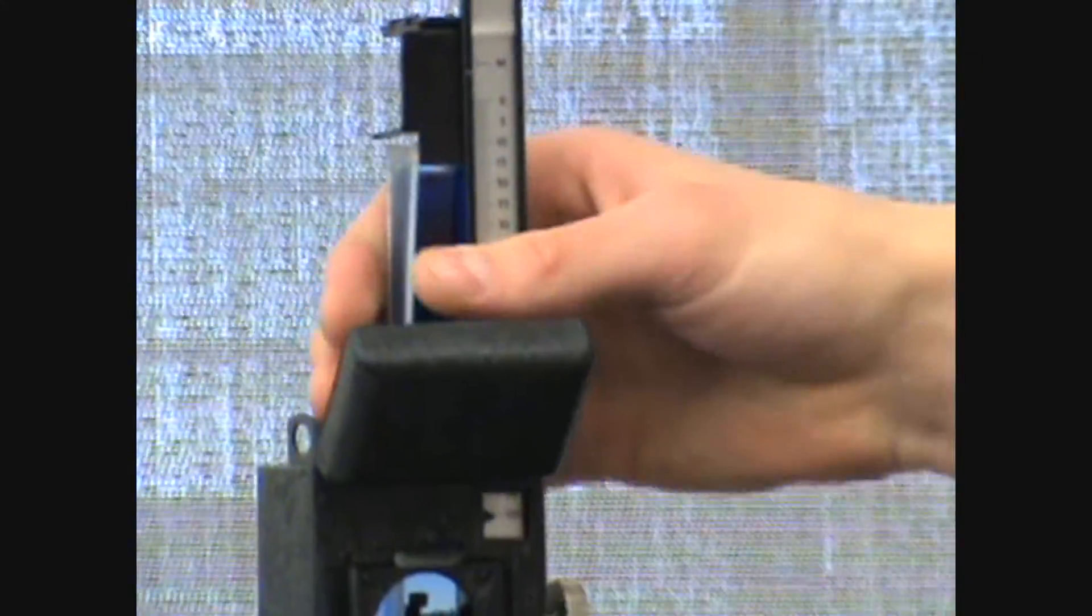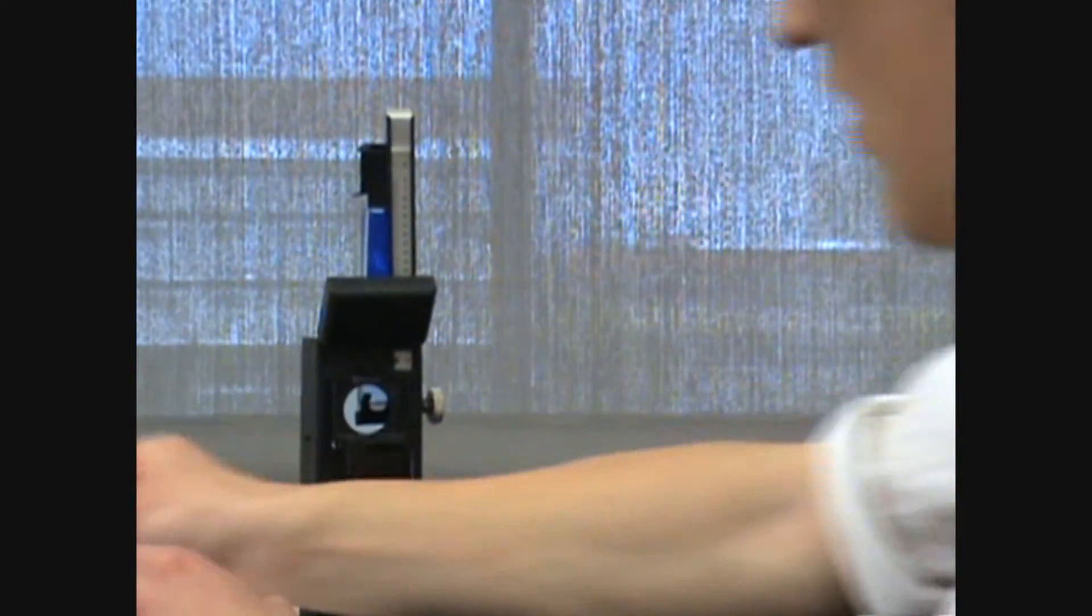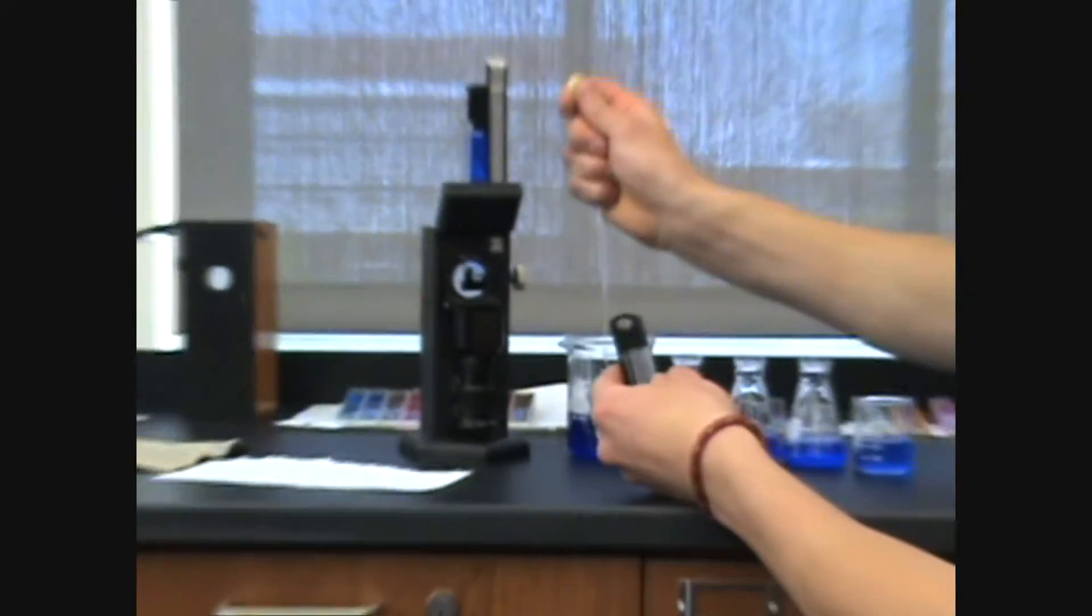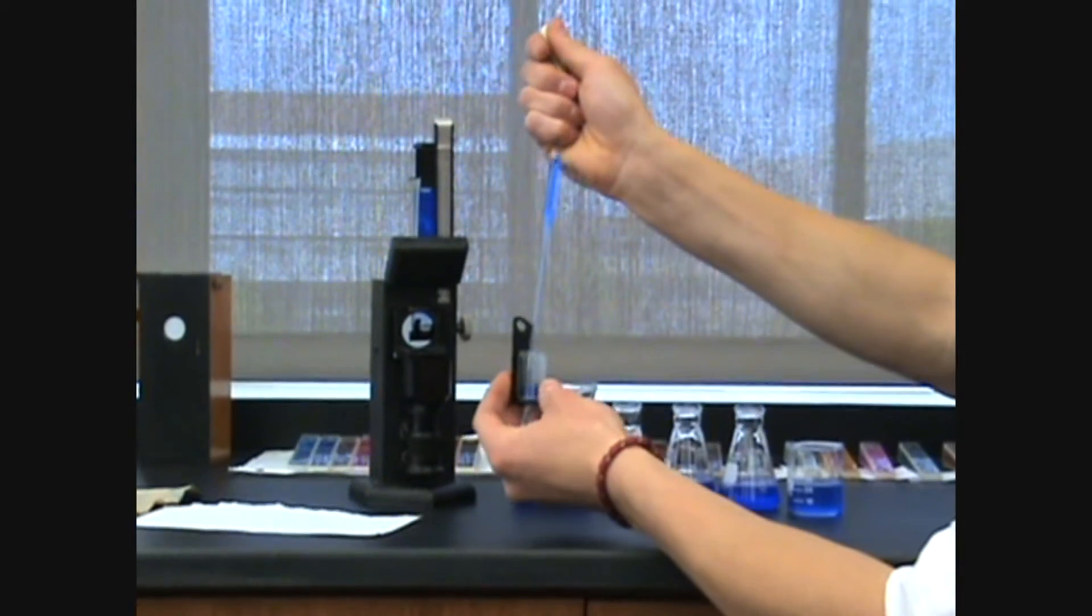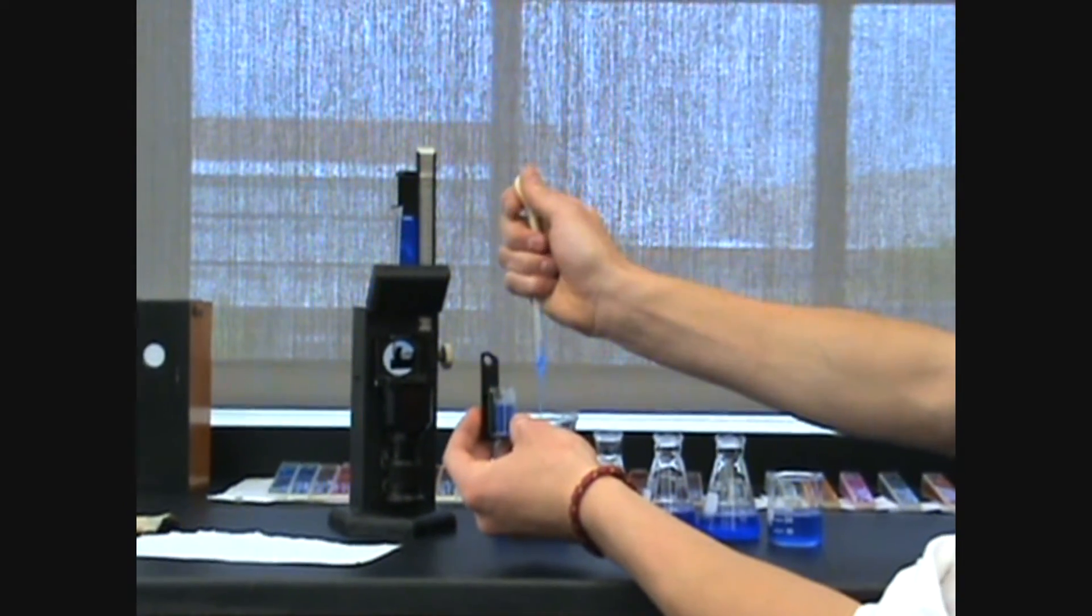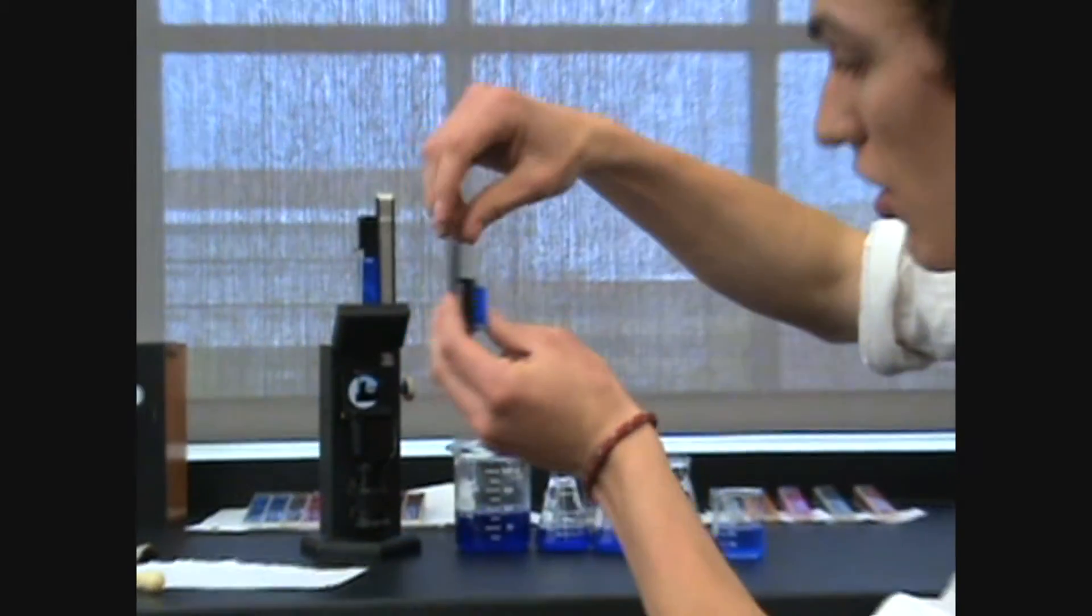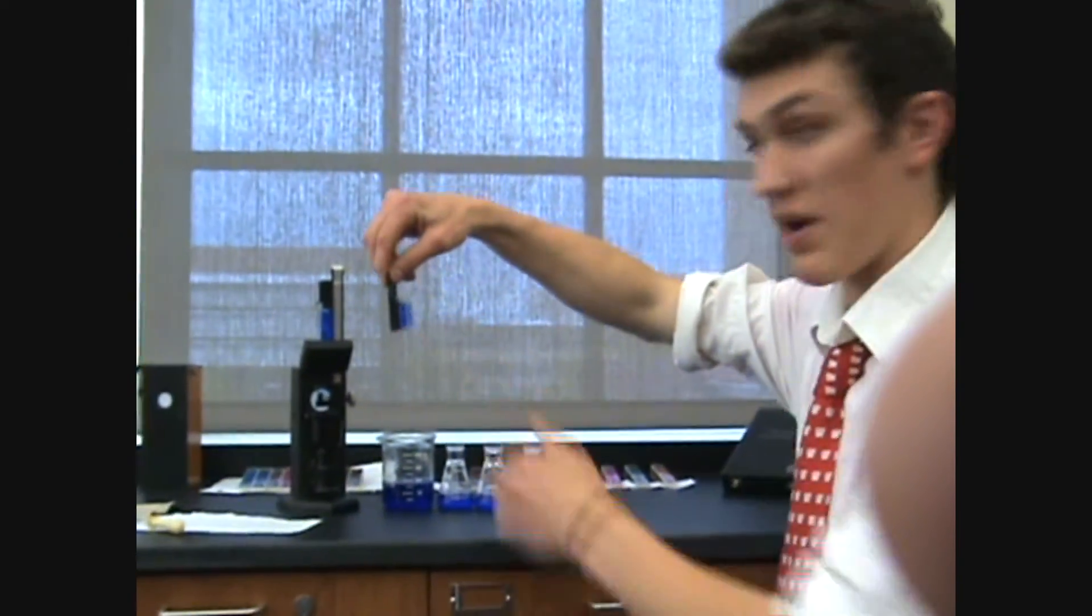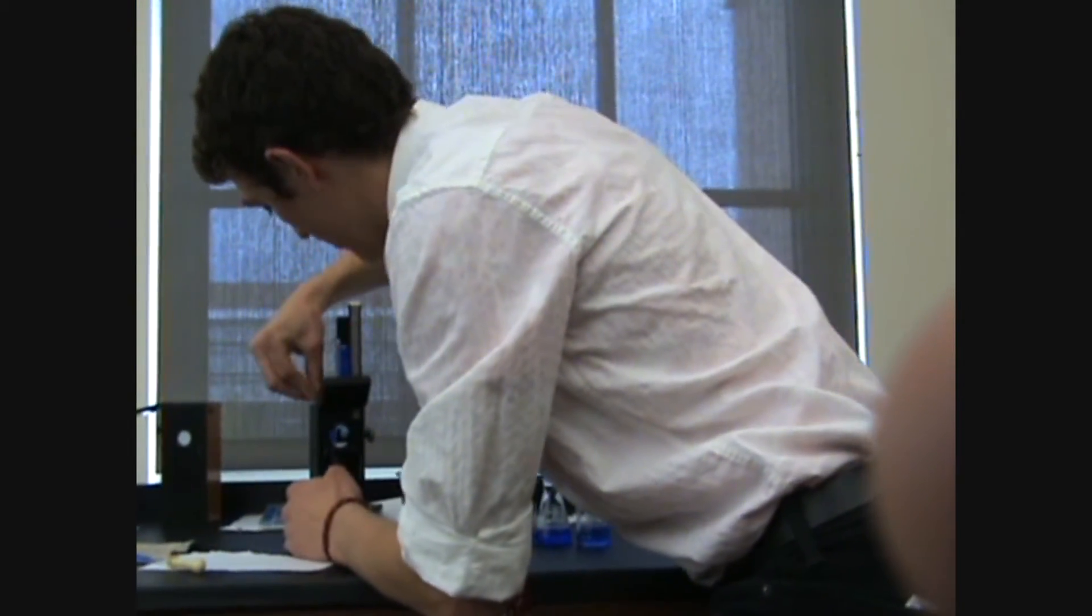So, what I first did, I had my cup, and then I took the 100% with the pipette, filled up the cup, making sure that there are no bubbles that will alter the light path. And I put it in.